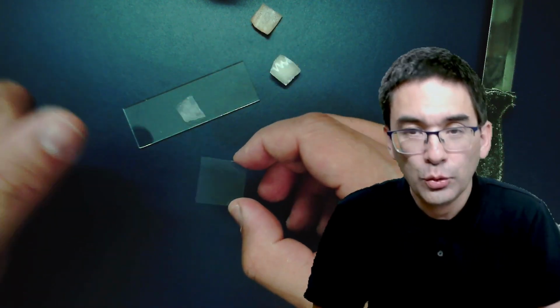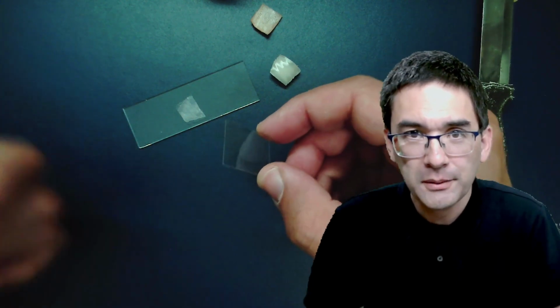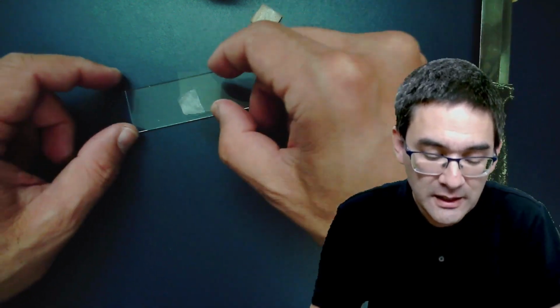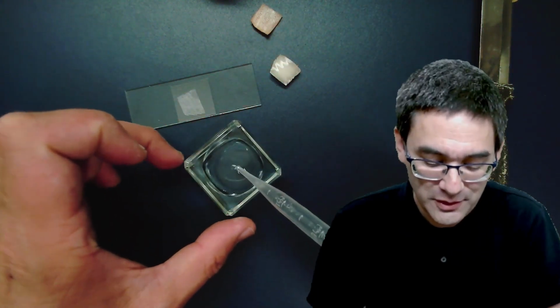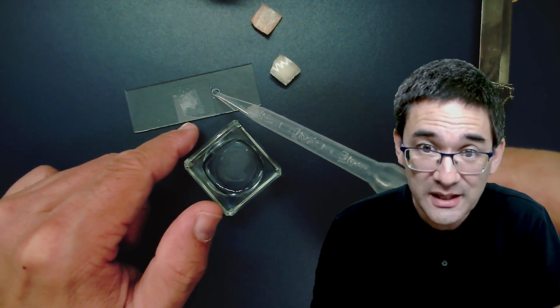slide. Normally you put water first on the slide. That's possible, but I found it kind of difficult to put it into the water directly because it doesn't want to stay in there. So I just put it directly on the slide. Cover glass goes on top. Okay. And look, and now I'm adding the water. Okay. So I have got some water here. Yeah. And now on the side, I'm adding the water, and you see how the water is nicely drawn in.